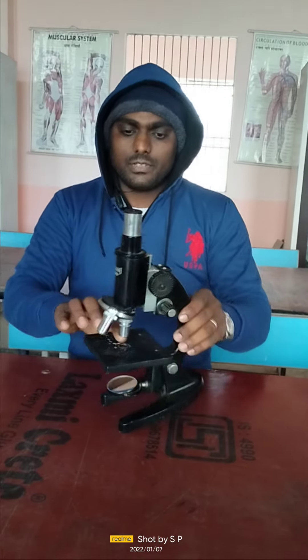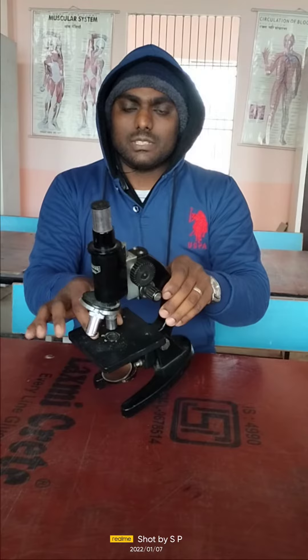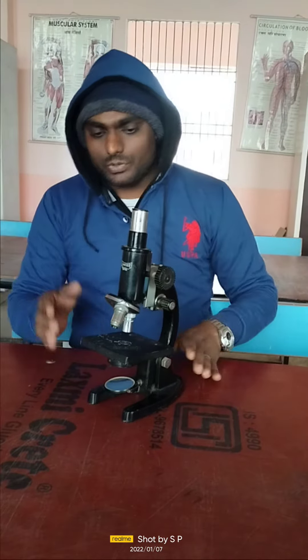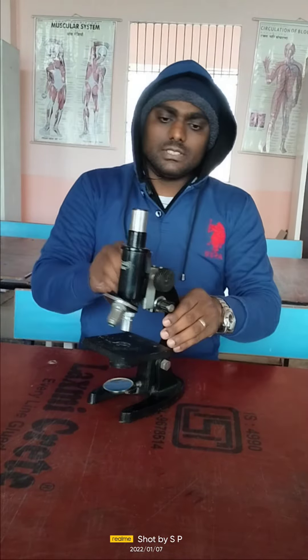This is the place where we can place our slide to observe the specimen, and this is the rotator with the help of which we can adjust the focus of our eyepiece near or far away from the specimen.